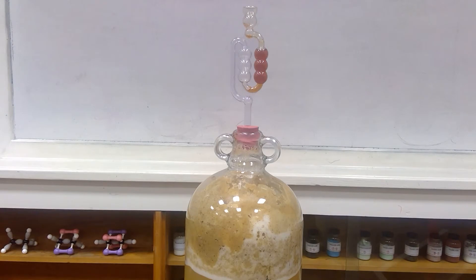The fermentation experiment has now been left for three days. You can already see a large amount of froth has appeared at the top of the fermentation vessel. This is caused by the carbon dioxide produced during fermentation. You can clearly see that carbon dioxide bubbles are coming through the air trap fairly rapidly. The purpose of the air trap is to allow carbon dioxide to leave the vessel but to prevent oxygen from entering, thus maintaining anaerobic conditions. Finally, you can see that already, after three days, the universal indicator in the air trap has turned from green to an orangish-yellow colour, which is indicative of the acidic gas carbon dioxide.